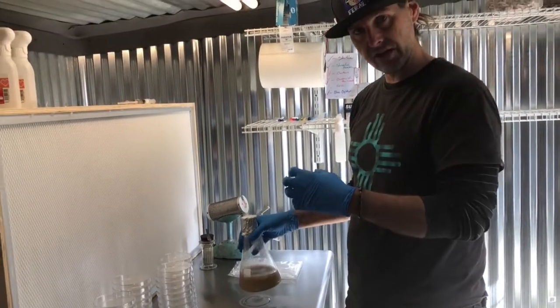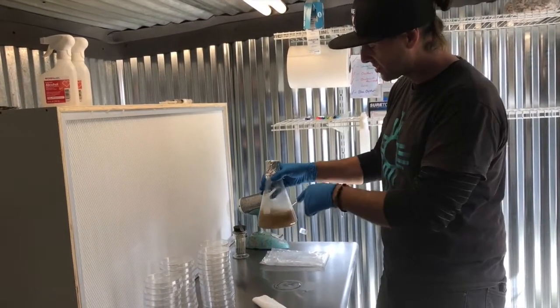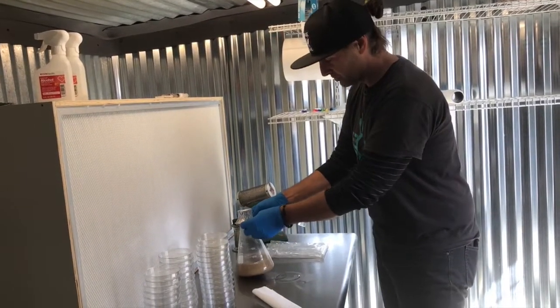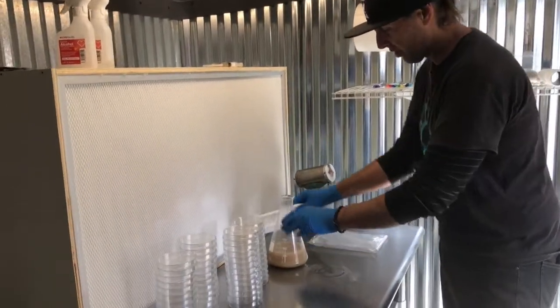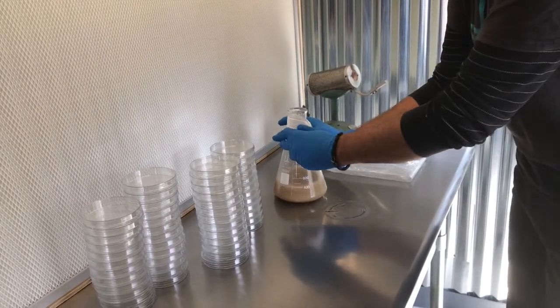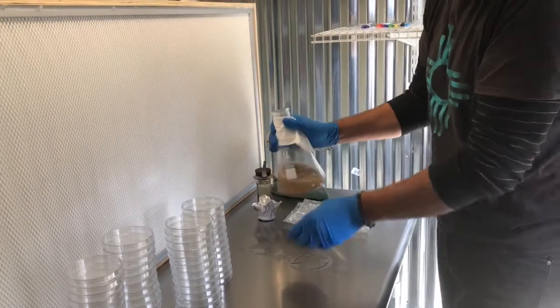I don't like the media bottles because they're very thick Pyrex and they hold heat really well. These flasks don't get as hot on your hand. What I do is take the lid off and then wrap a paper towel around it like this. That does a couple of things — it insulates your hands from the heat, and if you get any drips, they stop right at the paper towel instead of running all the way down the flask.